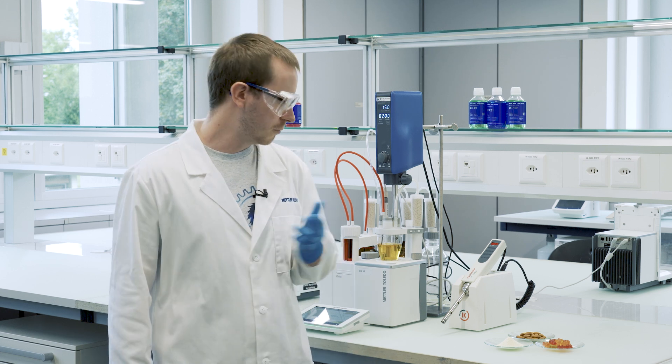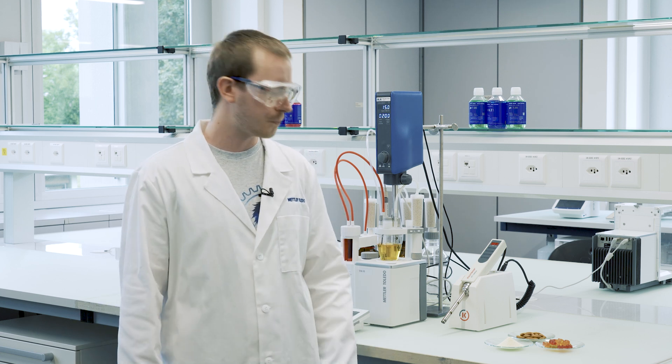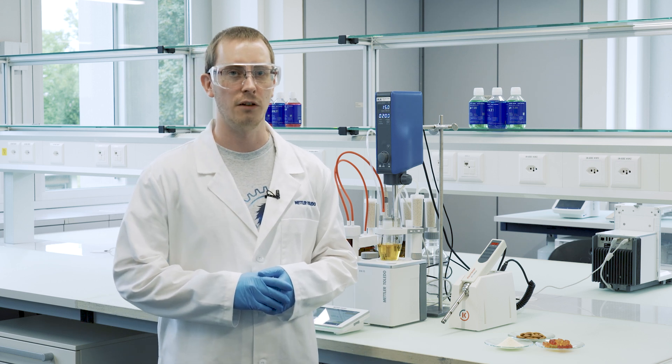I have for you three examples out of the food industry where homogenizers are most often used, starting with the milk powder which actually does not dissolve. It floats on top of the solvent and the homogenizer helps us disperse it.